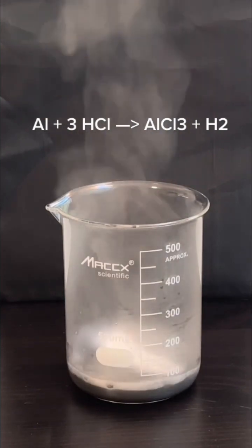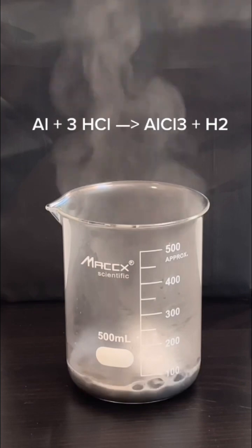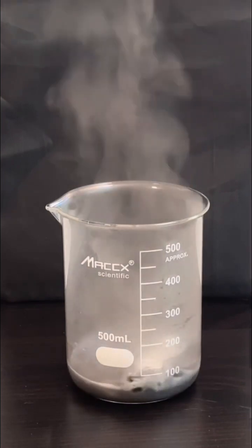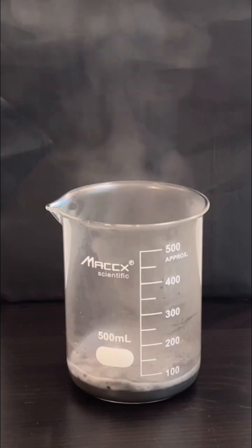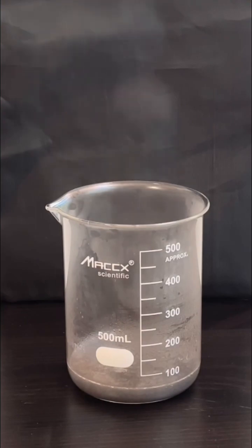The reaction gives off a lot of heat which is why it steams a lot. And by the end of the reaction the aluminum foil is completely gone.